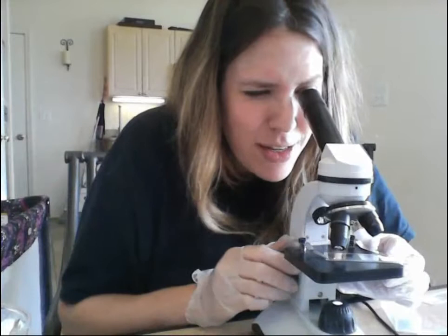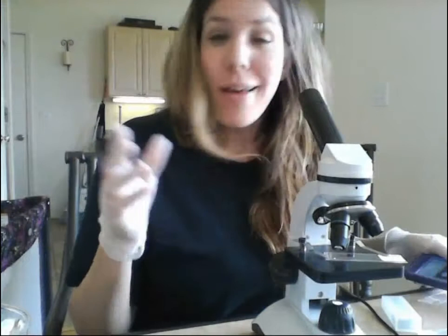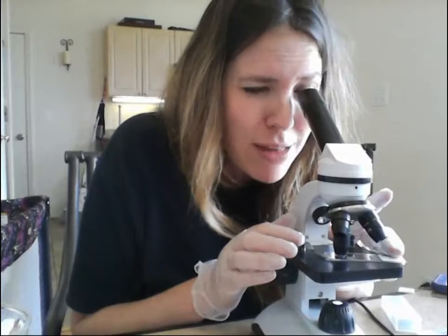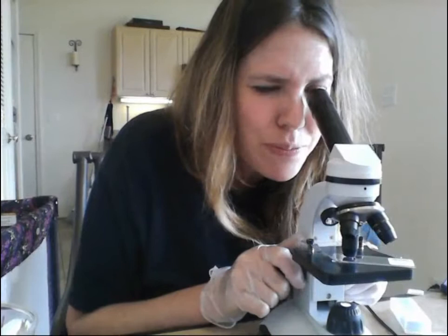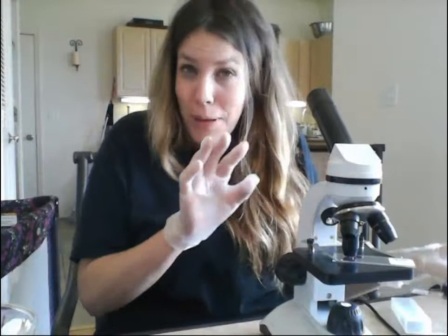Let me show you how pretty this is at 10x — these pictures don't do justice to what I'm seeing under this microscope. When you get to the 40x objective at 400 total magnification, I can see goblet cells, epithelial cells, and connective tissue. The very outer layer is called a simple columnar epithelium — the cells look like little columns and you can see the nucleus in each one. Do your best to take a picture at the highest magnification of your mammal colon and turn it in.